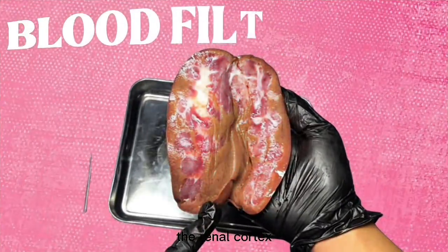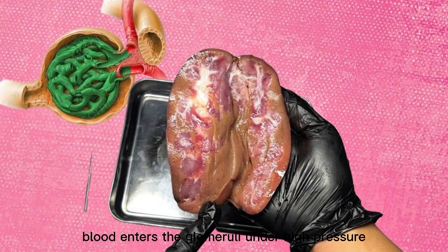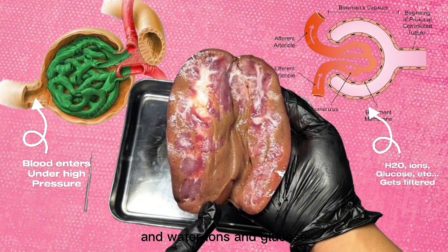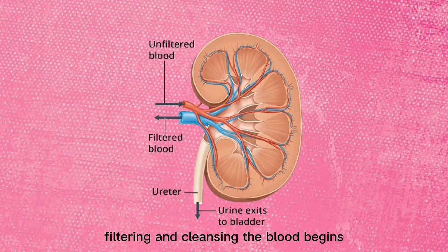The renal cortex serves as the main site of blood filtration. Inside this region, blood enters the glomeruli under high pressure, and water, ions, glucose, and small waste products are filtered out into the Bowman's capsule. This process produces the initial fluid that will eventually become urine. In short, the renal cortex is where the kidney's vital work of filtering and cleansing the blood begins.